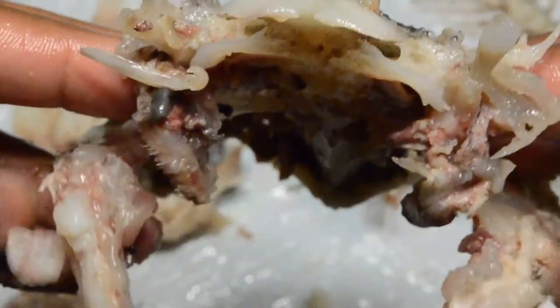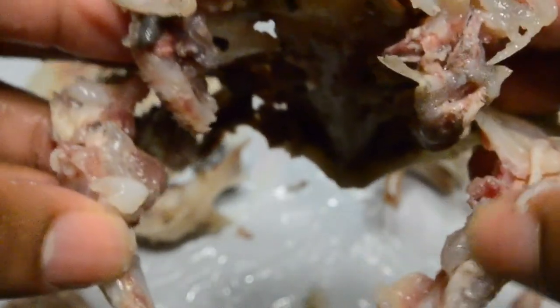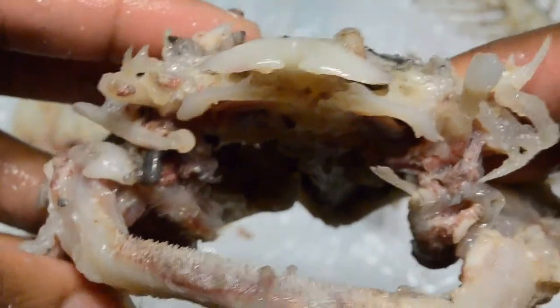You have a big mouth — look at that, the gape is just huge. Obviously this is not what it usually is, but it can really open up wide. There's a lot of footage of catfish swallowing things too big for them — I just watched one today of a catfish trying to swallow a turtle.